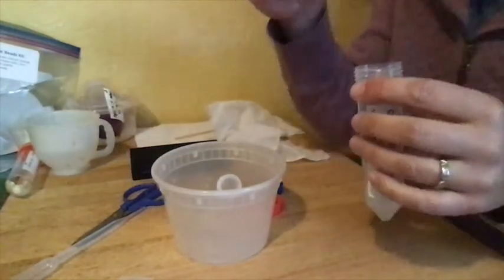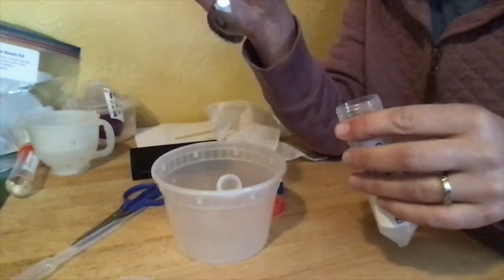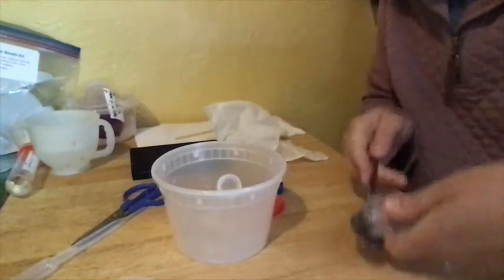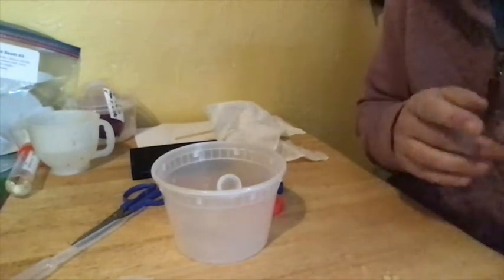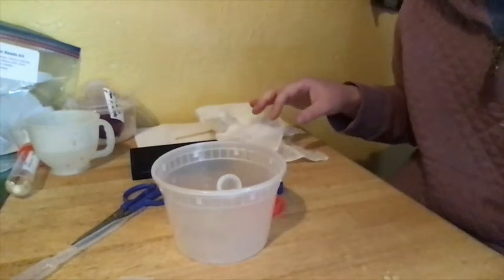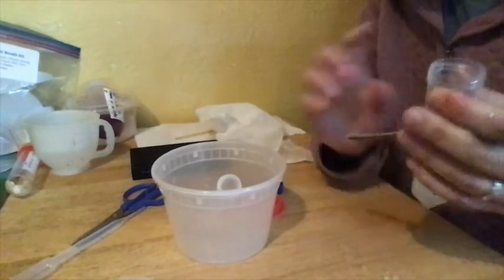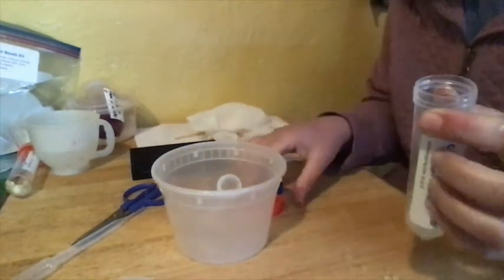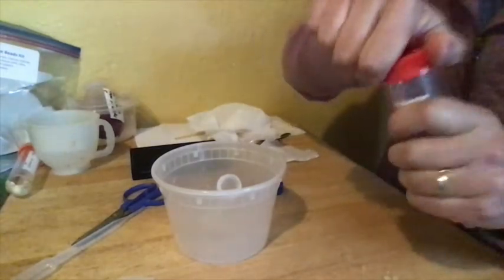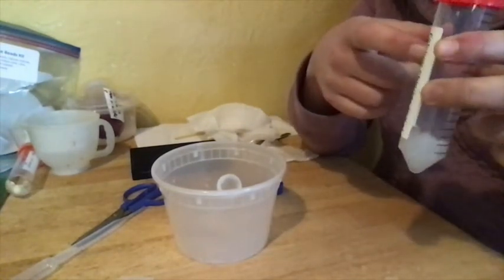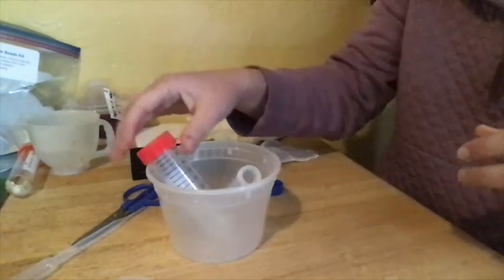You're going to spoon some of them into your wells. This is not the right spoon, so you can kind of shake them into a spoon. And you want to put those into your urease bead wells. So these are your urease beads that are going to go into your last two rows. You're not going to use all of these. The rest of them that you don't use, you're going to cap up securely and pop these in your fridge. You're going to need these for when you make your medical device.